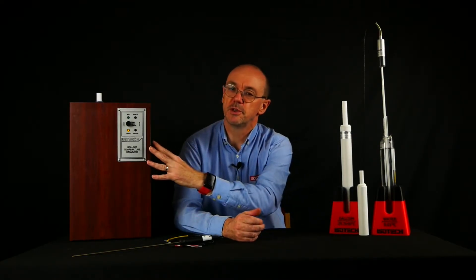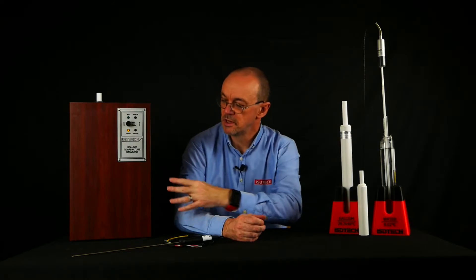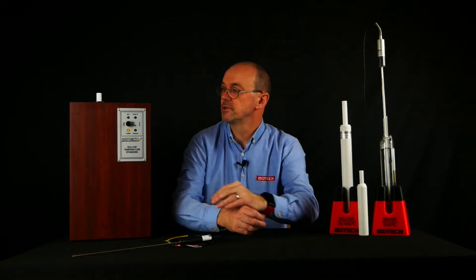It's a lot more convenient to use a dedicated apparatus. This is the Isotech gallium apparatus and it's simplicity itself to use.